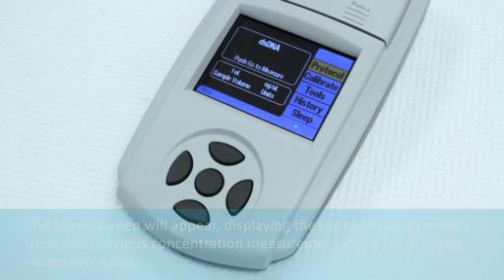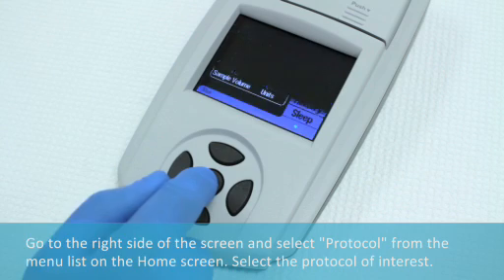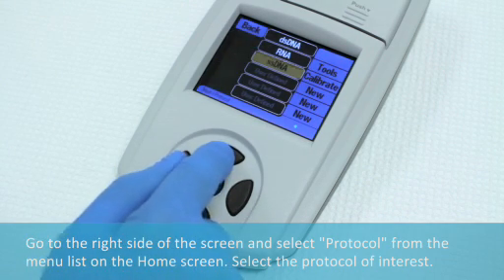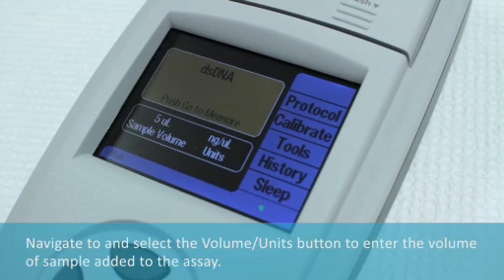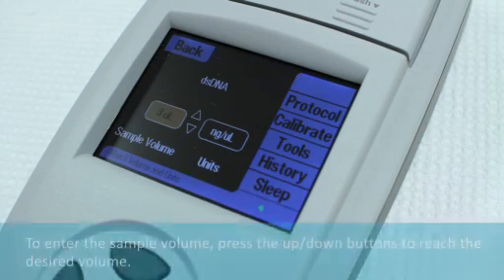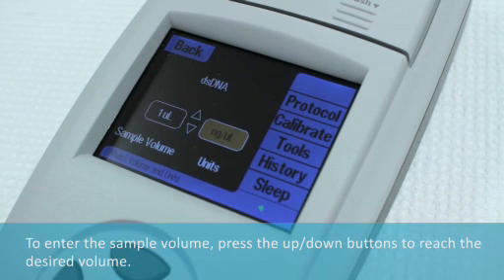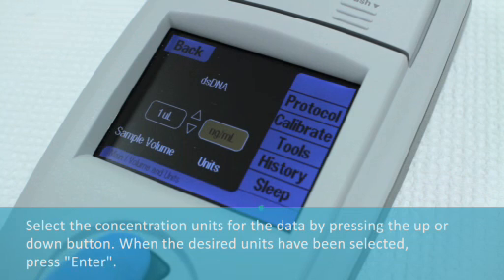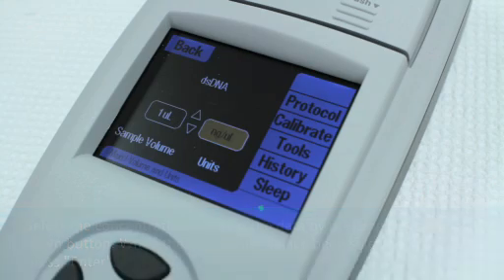Go to the right side of the screen and select Protocol from the menu list on the home screen. Select the protocol of interest. Navigate to and select the Volume Units button to enter the volume of sample added to the assay. Press the Up or Down buttons to reach the desired volume, then select the concentration units for the data. When the desired units have been selected, press Enter.